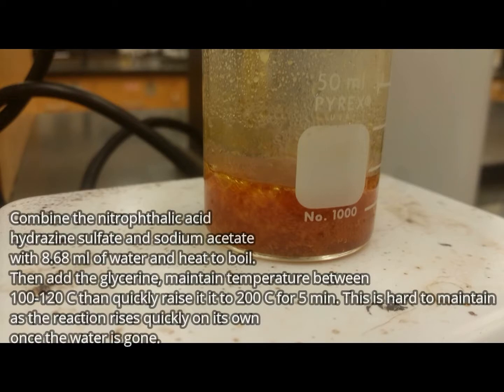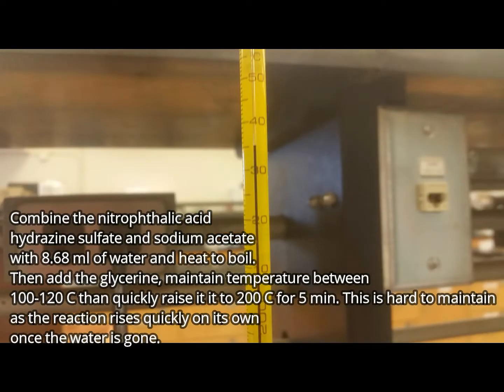It is very important to monitor the temperature of this reaction. However, the reaction tends to drive itself, and it is very hard to maintain a constant temperature around 200 C. As you can see, it spiked all the way up to 235 for me.